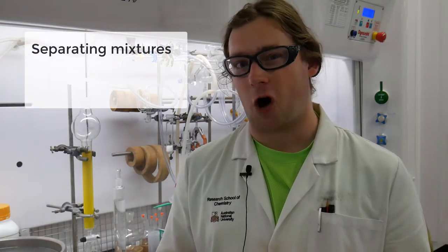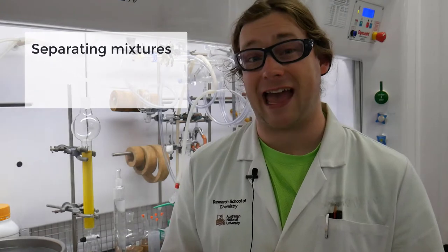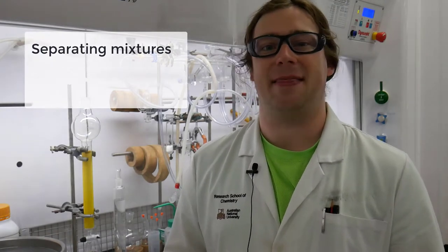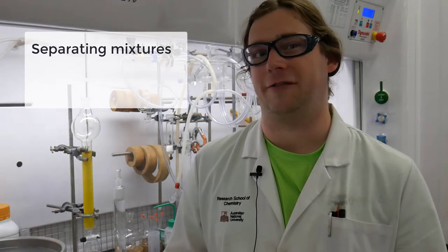The last technique I'll show you today is perhaps the most commonly utilized technique we have in synthetic chemistry, and that is what we call column chromatography.